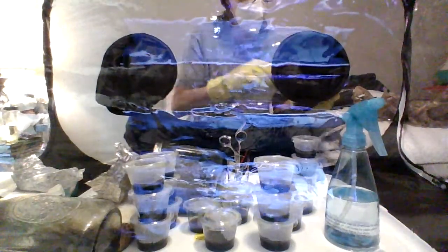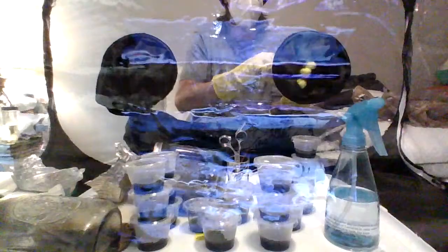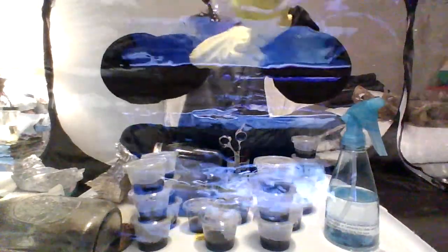Doubling up my gloves, like always. I got my nitrile gloves, and then I put my latex dishwashing gloves over them. They're like, I don't know, Arm & Hammer brand. Doesn't really matter. Just keep them clean. That's what matters. Why is that rolling back? Don't roll back. There we go.